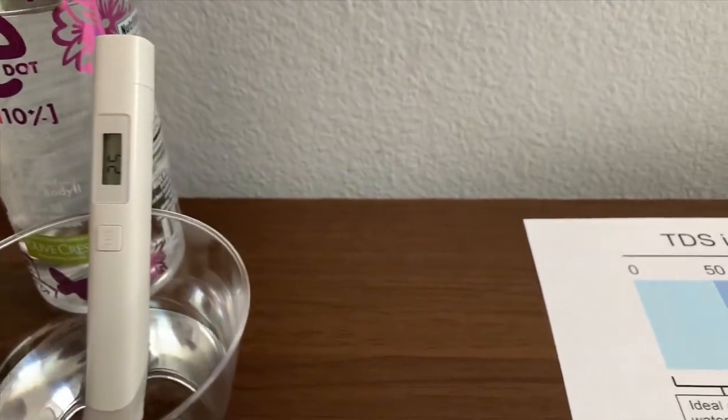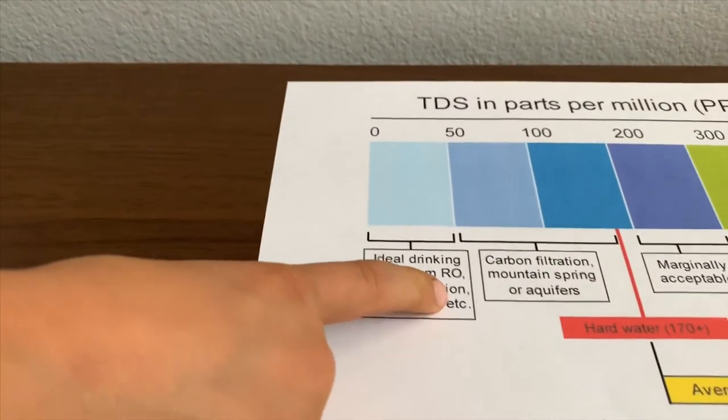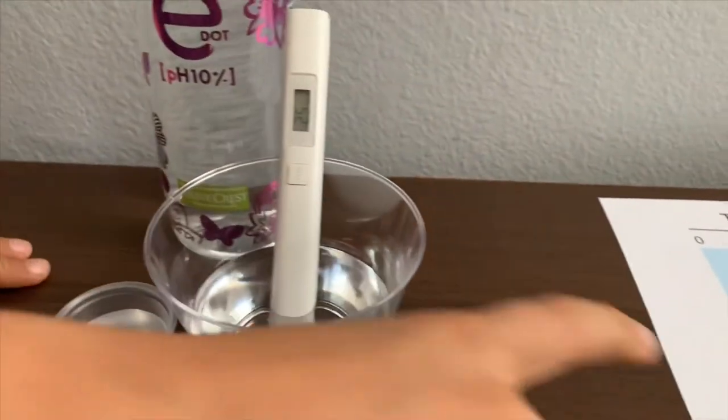Twenty-six. That is micro-filtered distilled water. This is micro-filtered water.